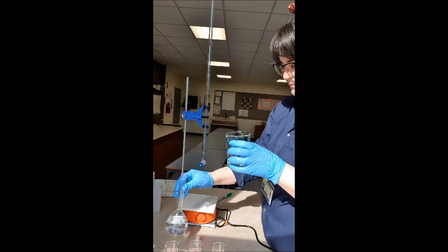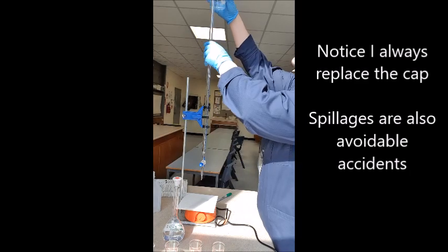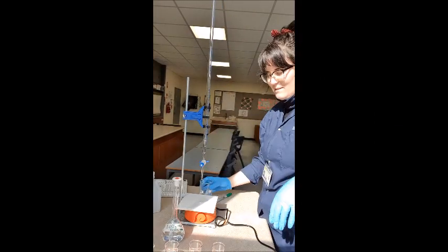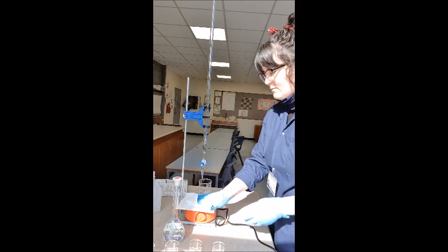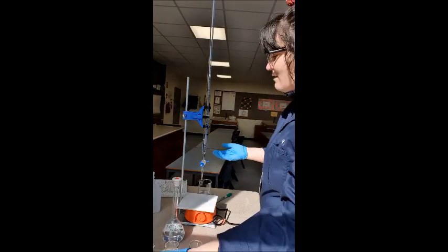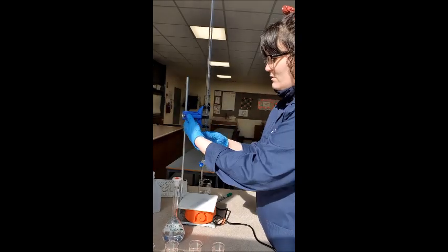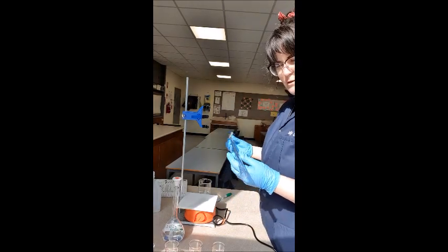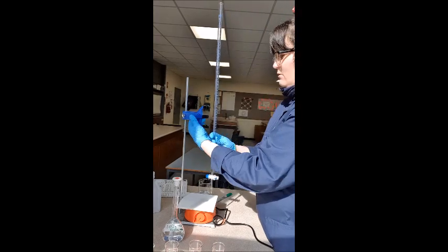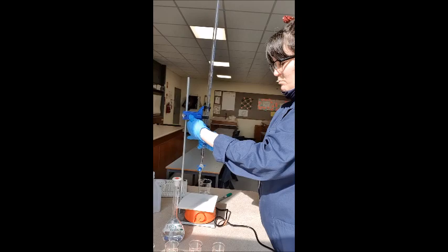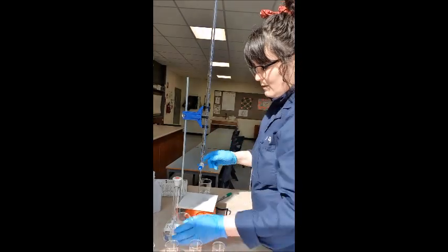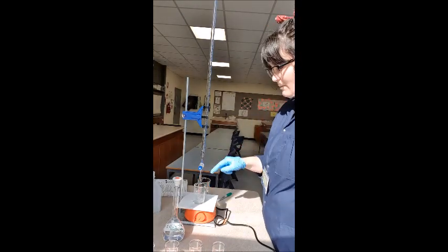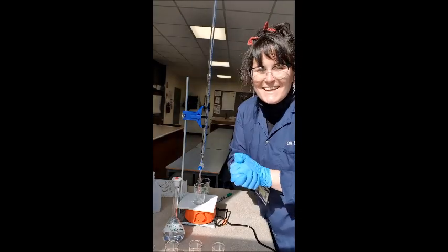Now I'm going to fill it up and fill up my burette. Oh, I left it open. Classic mistake. Same as what I've said with everything, we're using this burette to measure or to hold the sodium carbonate. So again, we want to rinse it with that sodium carbonate. So that's gone all the way up. And then I'm going to empty this bit that I've put in there into my waste beaker, because this is our rinse. We don't want to use this one. So that's just emptying in there. Once it's emptied, I will fill it up again, and we can start our titration.